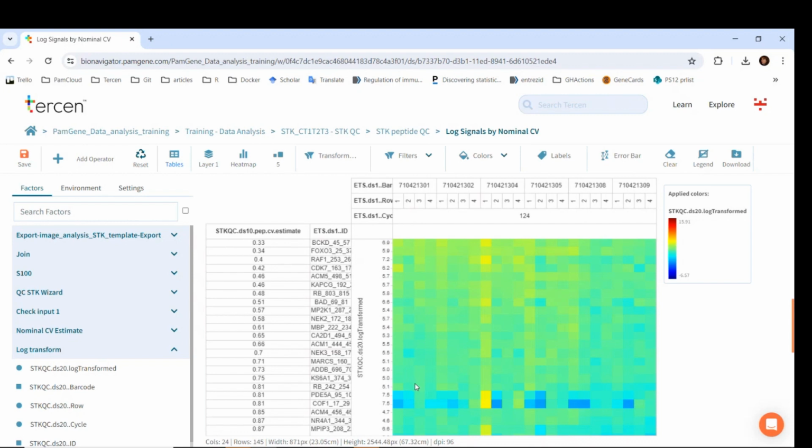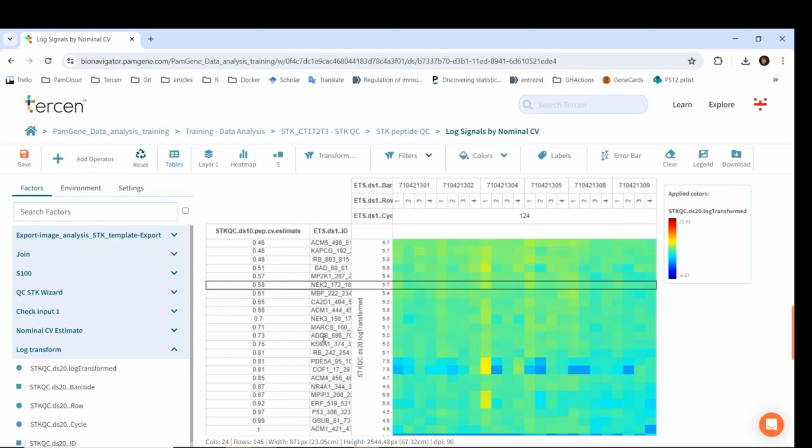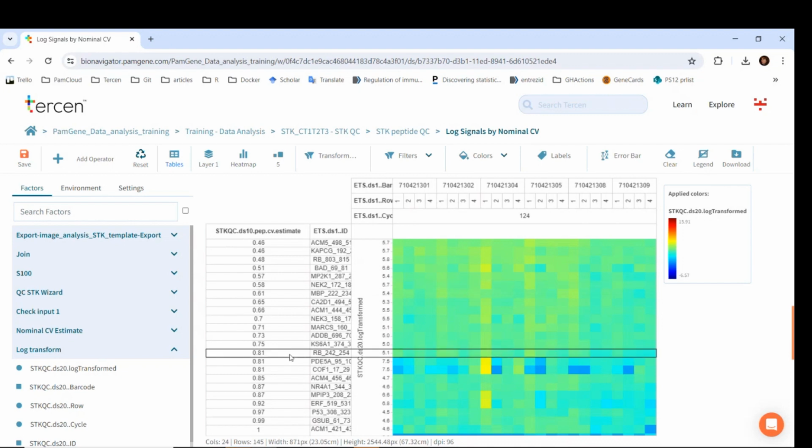Importantly, again, we always have to revise this. Most of the time, 0.5 is a stringent threshold, and we do not get a sufficient number of peptides passing it. Therefore, please carefully inspect this heat map. If the values on the heat map a bit higher than 0.5 have similar values as the ones just below 0.5, you can set the threshold higher, making it less stringent. For example, in this case, I would set the threshold at around 0.8.